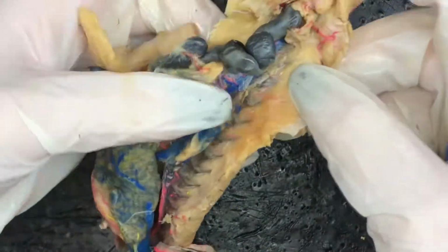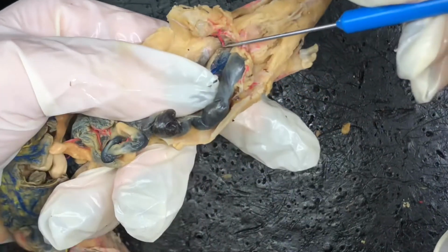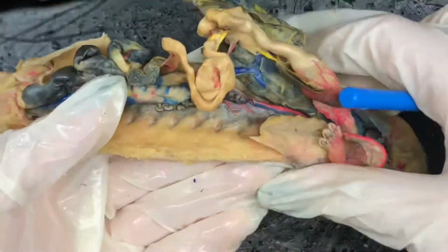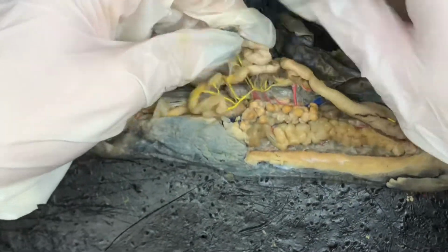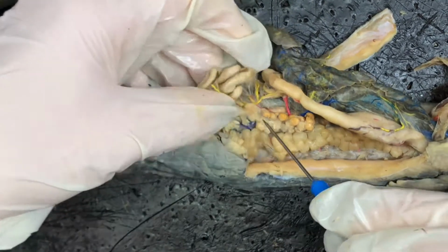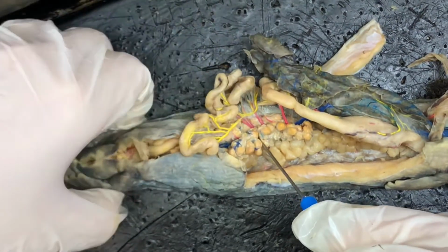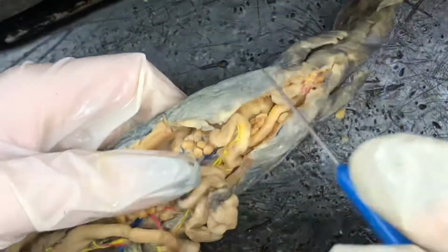We have the pelvic veins also running down here towards the bottom. You can kind of see them on this side. Pelvic vein, you can see one running right there. That darker portion is a pelvic vein. And then we have mesenteric arteries and veins. So we can see in the mesentery, we're going to switch over to this one. So here's our female again. We have our stomach, orient ourselves. Here's the small intestine. The mesenteric arteries and veins are right here. The veins are dyed yellow, and then the arteries are red, as they typically are. And then we also have the ventral abdominal vein, which is going to run this way. It's going to be running towards the bottom.